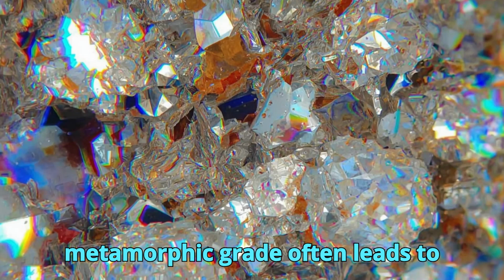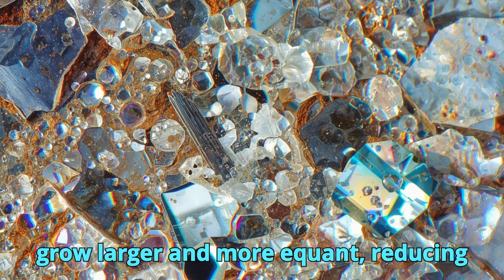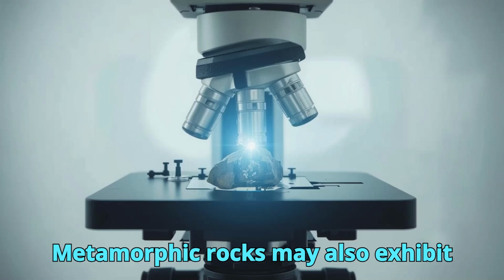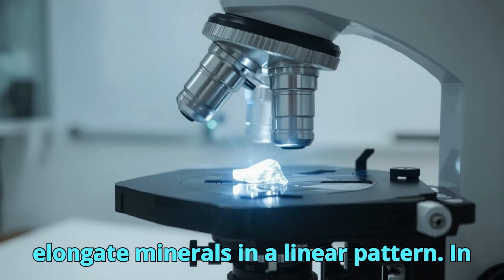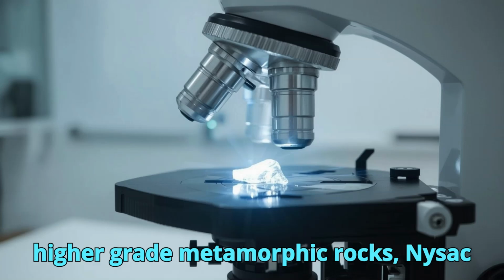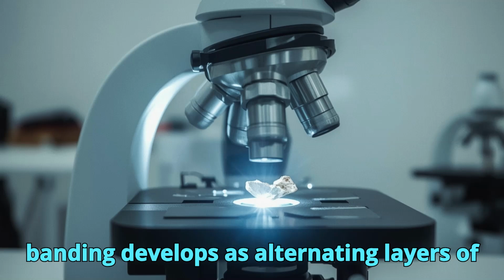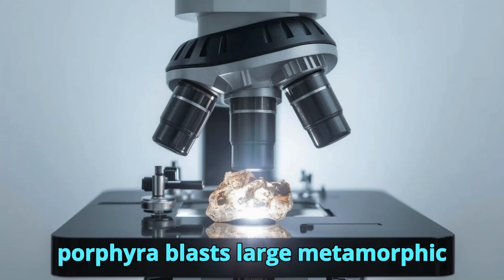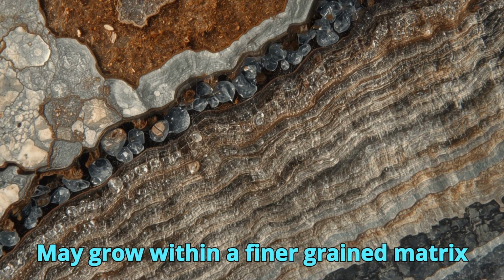Increasing metamorphic grade often leads to recrystallization, where mineral grains grow larger and more equant, reducing original sedimentary or igneous textures. Metamorphic rocks may also exhibit lineation, defined by the alignment of elongate minerals in a linear pattern. In higher-grade metamorphic rocks, gneissic banding develops as alternating layers of light and dark minerals, reflecting mineral segregation during metamorphism.